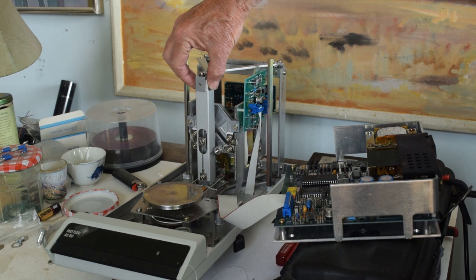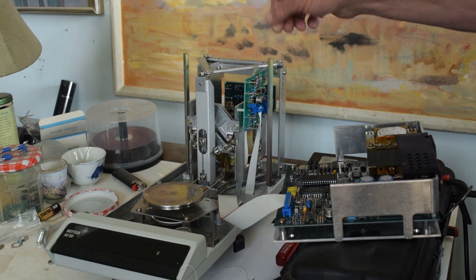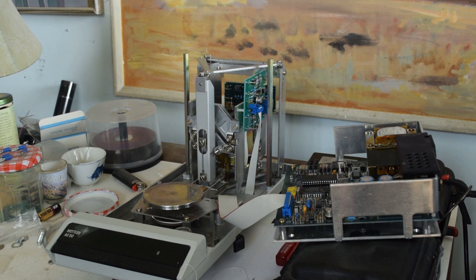I was concerned about this flexure I built and didn't expect it to be perfect, but I thought if I could get to a 10 milligram accurate repeatability I'd be fairly happy with it. There are a couple of things I want to point out.